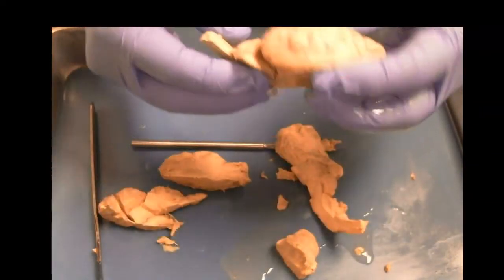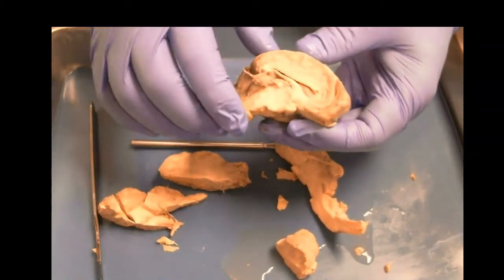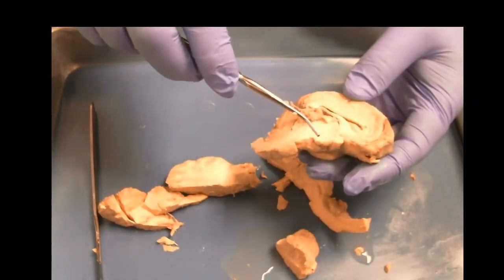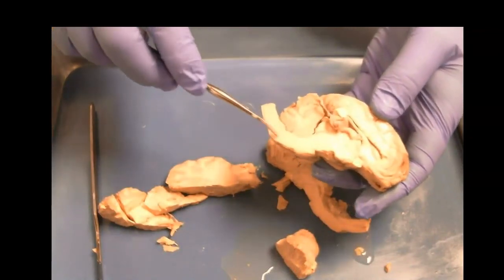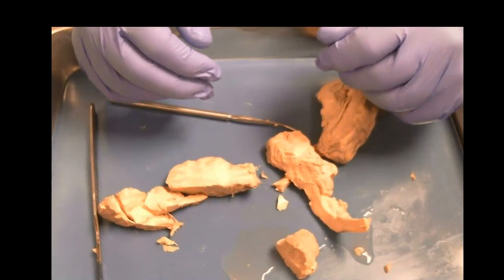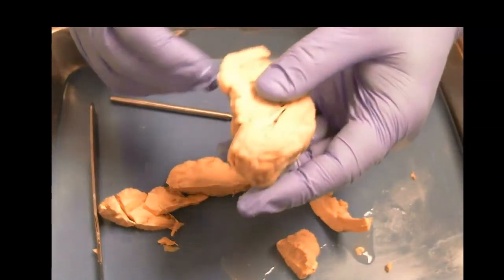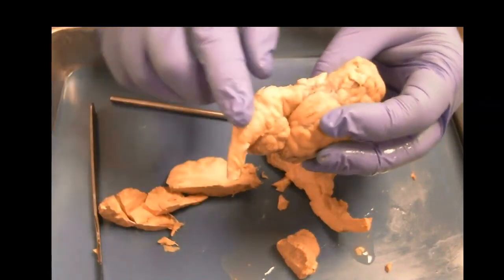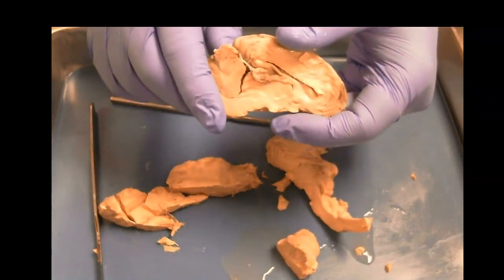So we go back and look at the brain we have not cut up, and the structures that we see here. I mentioned here was the pineal, the pituitary is down here. You've got your corpus callosum, thalamus, hypothalamus, mammillary bodies, optic chiasm, the frontal lobe, pons, medulla, and brainstem. All right, that's the basics of the sheep brain. There's a lot more detail that we can go into. Static pictures are probably going to work just as well, because in a lot of ways it's not easy to see everything in this kind of structure, especially with the nerves. So we'll look at some images to get a better idea of those.